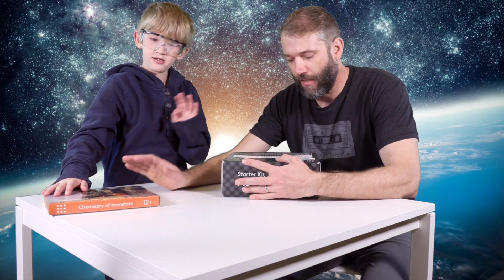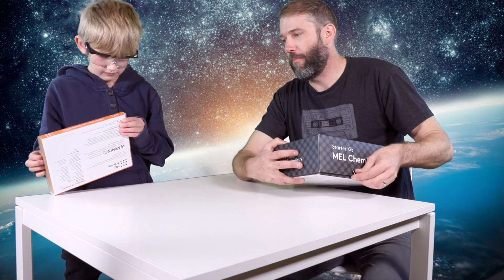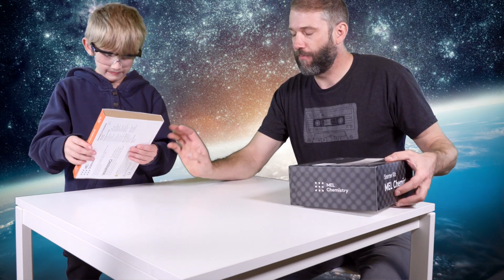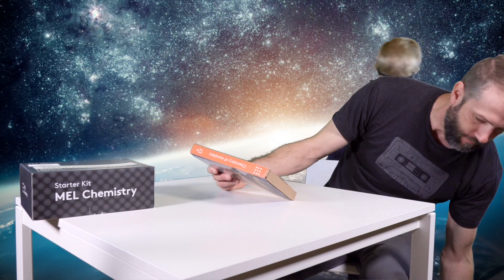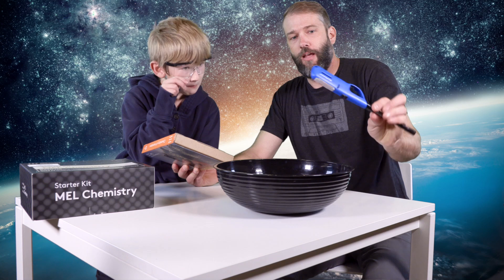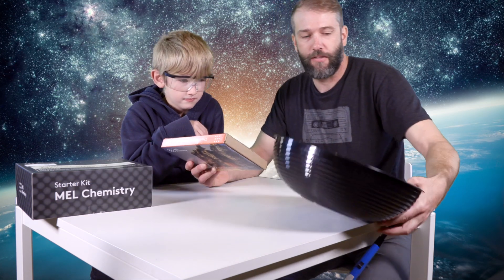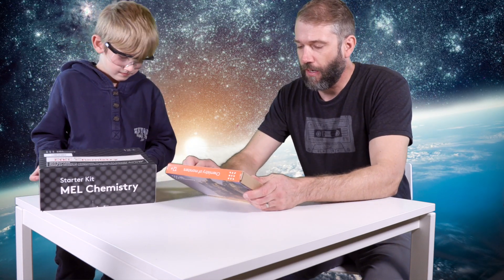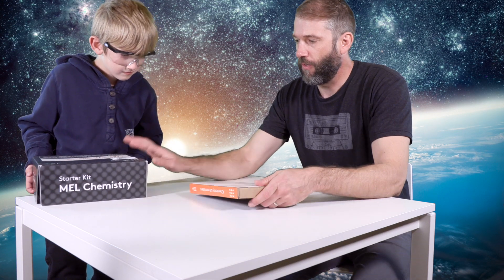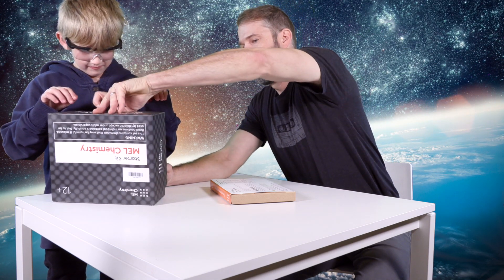So this is the actual project kit. We need a few things from the starter kit. On the back of the box is a list of things we'll need — things to prepare in advance: a big bowl, and matches. Instead of matches, we got a wind-resistant lighter. We have a big bowl and this lighter, which hopefully will suffice.